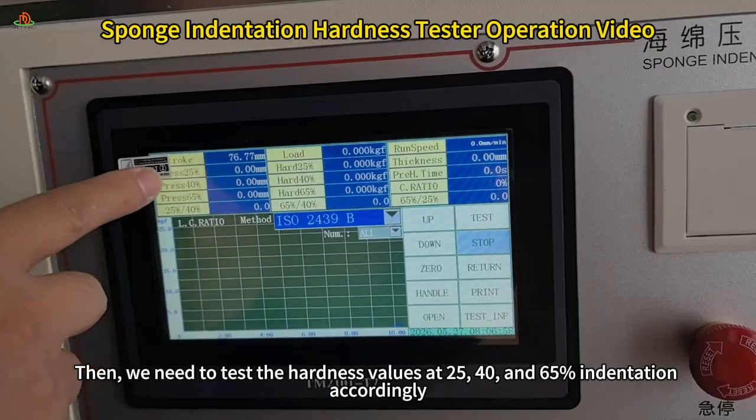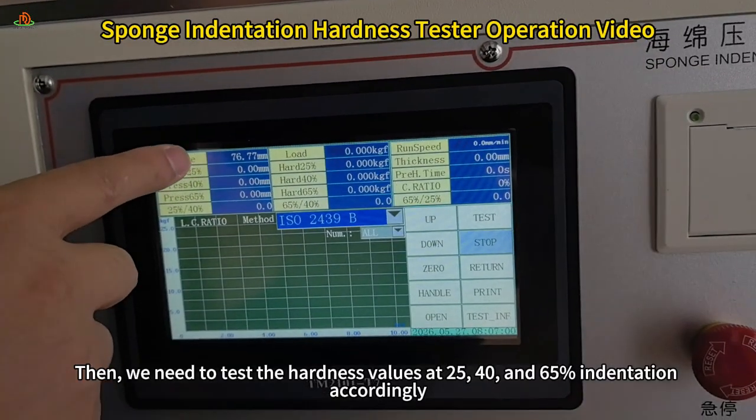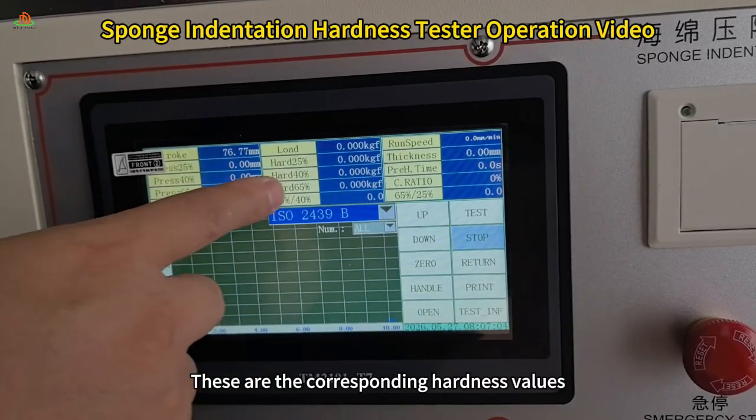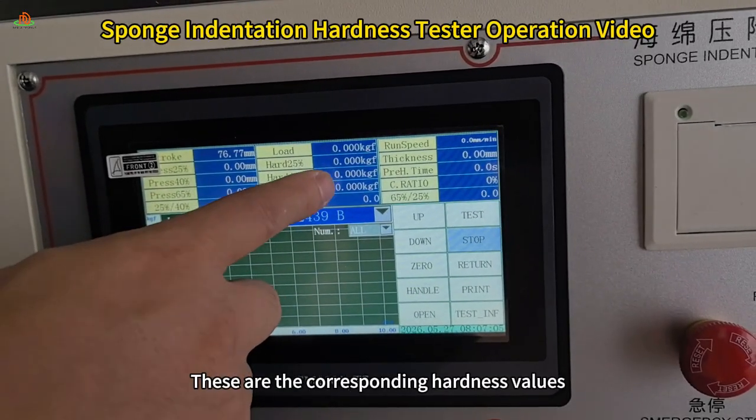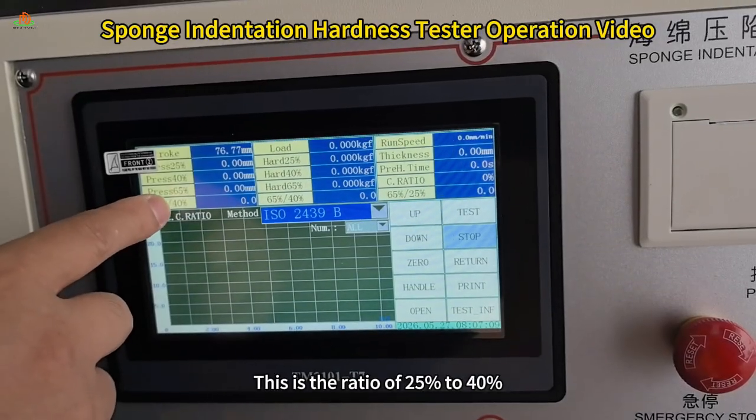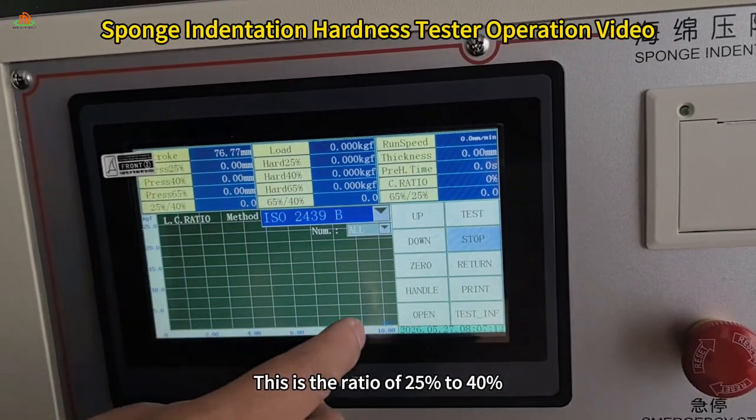Then we need to test the hardness values at 25, 40, and 65% indentation accordingly. These are the corresponding hardness values, and these are the corresponding indentation displacements. This is the ratio of 25% to 40%.